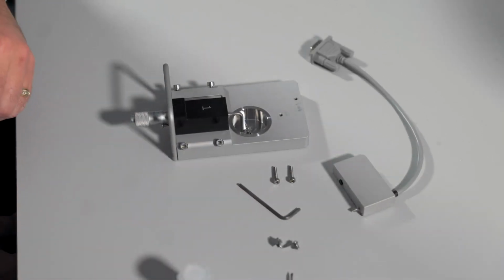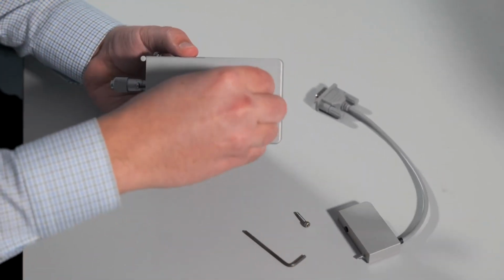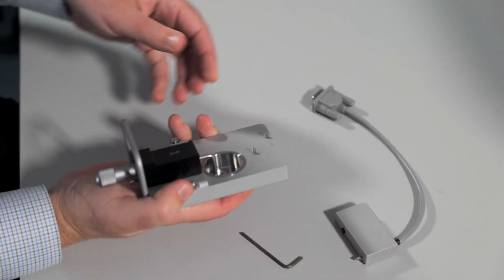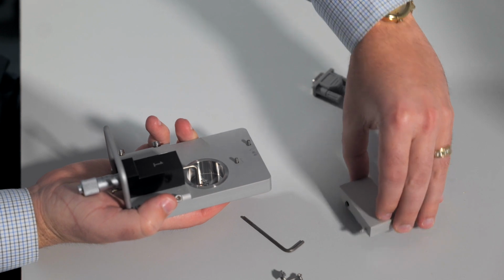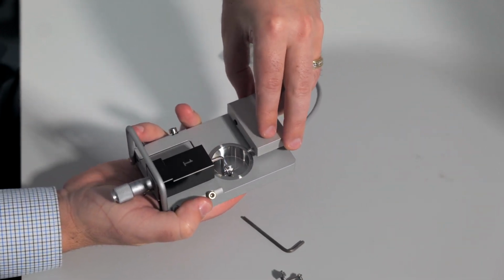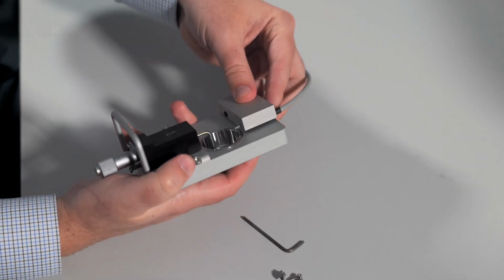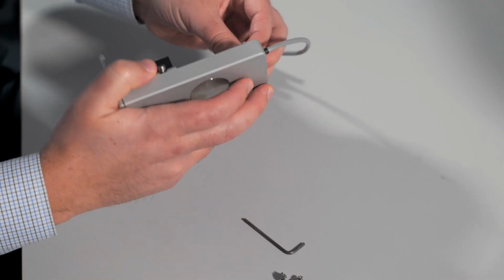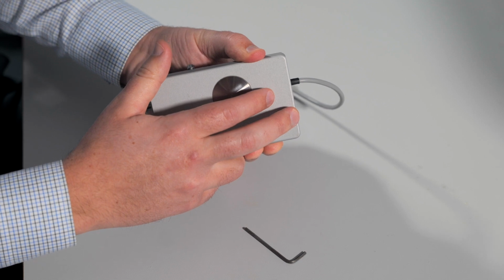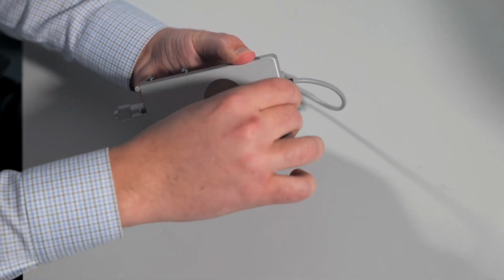In order to add the transducer, take your chamber, flip it over, and add the 2 screws in the bottom. You will hold these in place and take your transducer, line it up along the edges of the chamber, and set it in place. You will feel the 2 screws on the bottom start to push against you. Hold the transducer in place and take your Allen key to secure the screws.